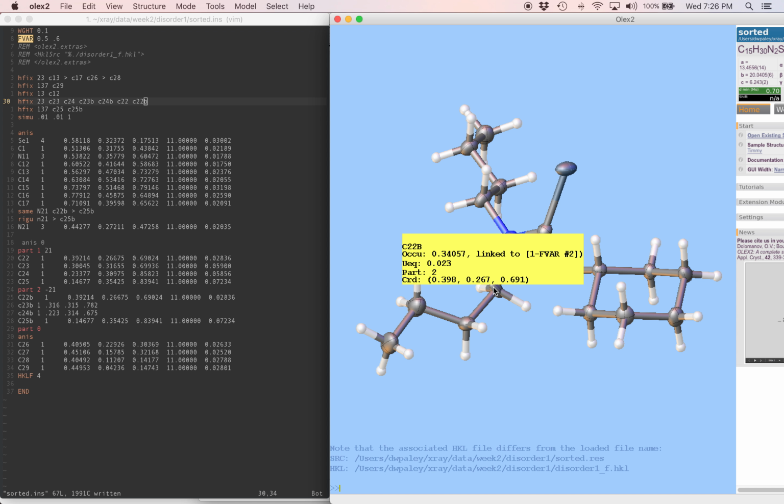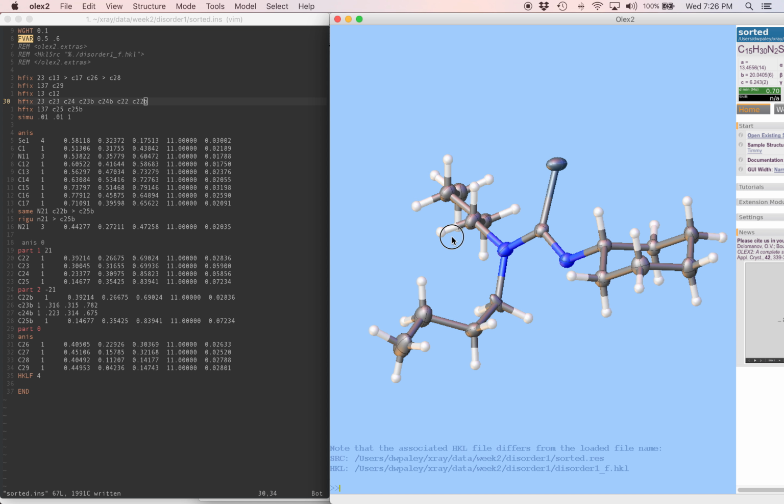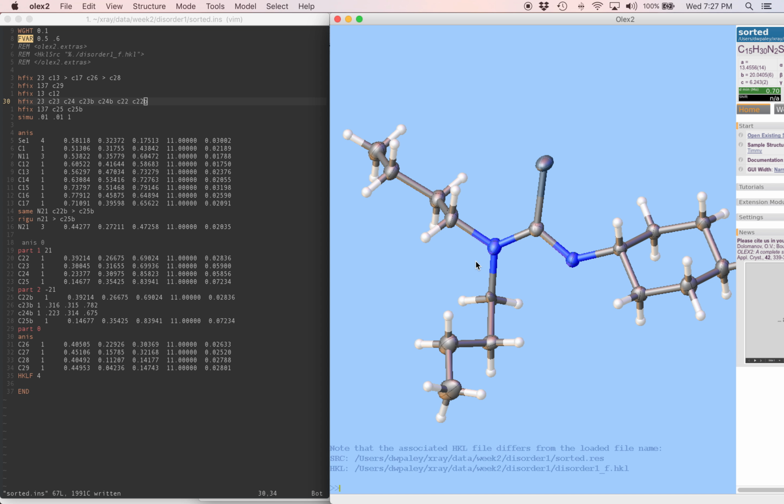Okay, I think we've got very reasonable geometry in the major part of the disorder. We've got not totally crazy geometry in the minor part of the disorder. Sometimes that's the best you're going to do. Even under the best circumstances, a disorder is going to come with a little bit less accurate knowledge of the geometric parameters in that part of the model. And it looks like we got hit by that a bit here, but we did our best to make everything reasonable with a combination of restraints and looking at the structure to see where it needed help.